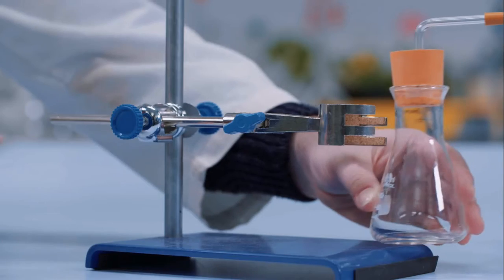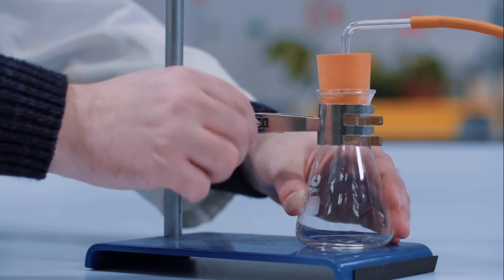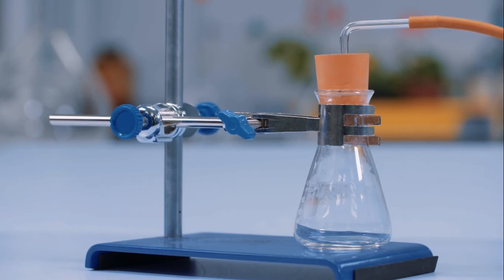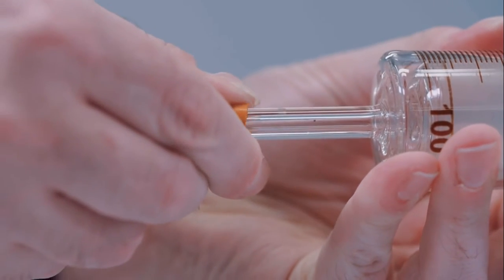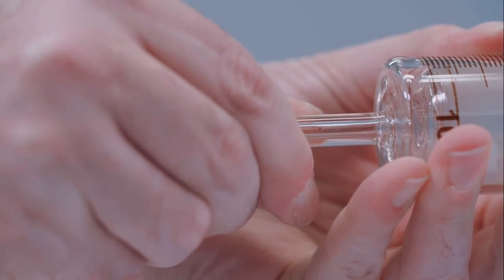The conical flask in which the reaction occurs is also clamped gently to stop it toppling over during the experiment. Make sure that the bung is a good fit for the conical flask. Also ensure that the rubber tubing is of a suitable diameter to attach firmly to the gas syringe and to the glass tube which fits into the rubber bung.